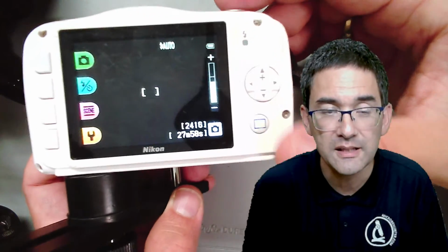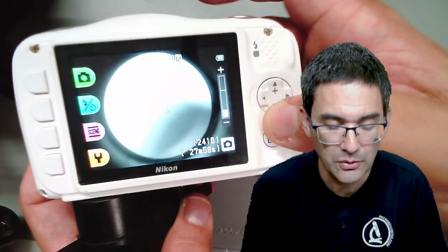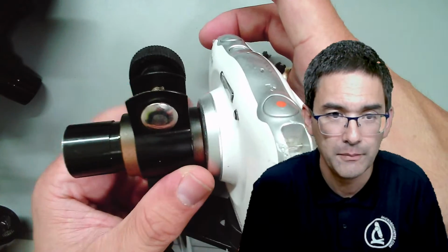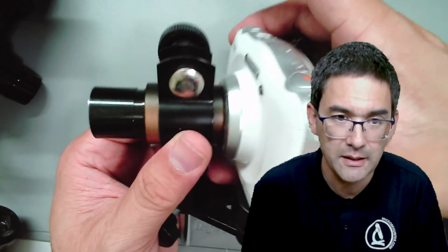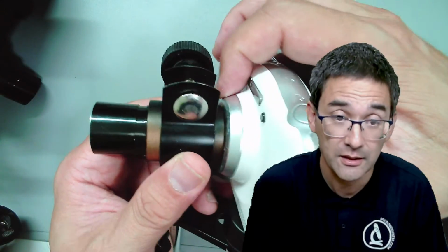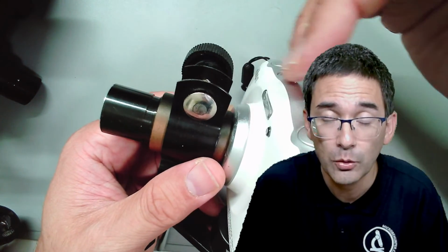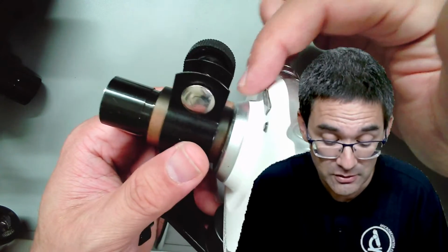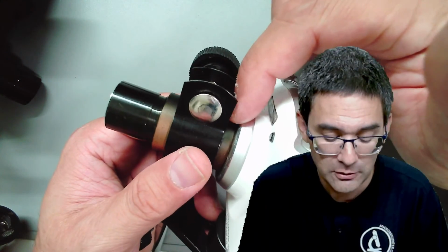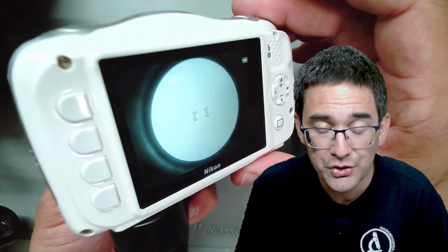And the disadvantage of this system, again, is that it's very, very sensitive to alignment. Everything has to be completely centered properly. Here I made it in such a way that it actually touches the front part of the camera. Some cameras have objectives that are able to retract and extend, so you have to be careful that they don't bump into the objective. But in this case it works. Again, you can make videos like this.